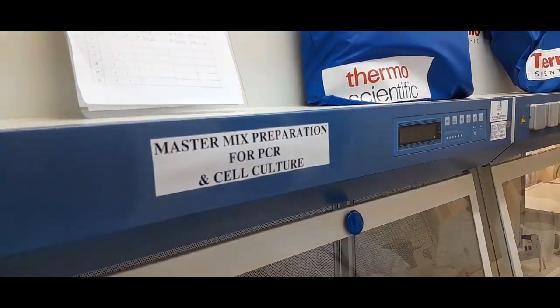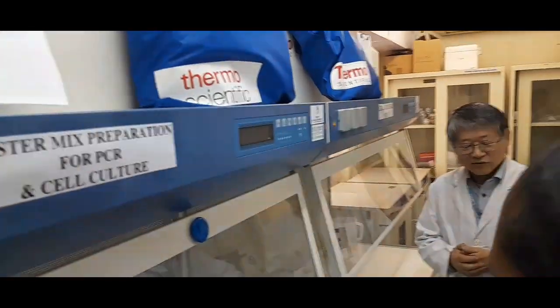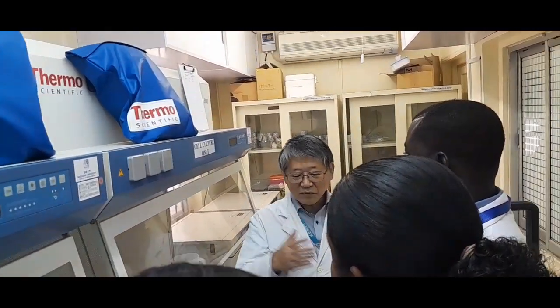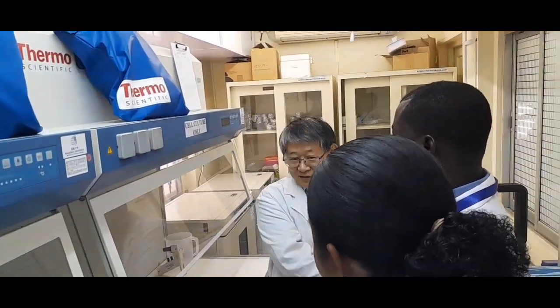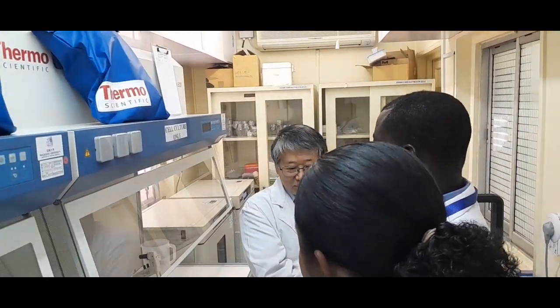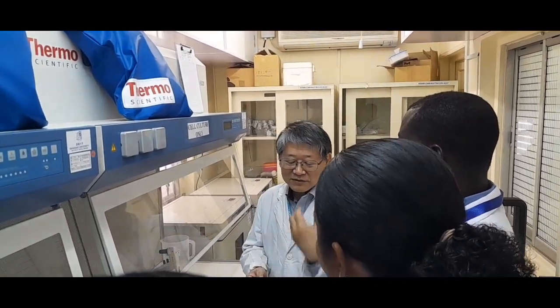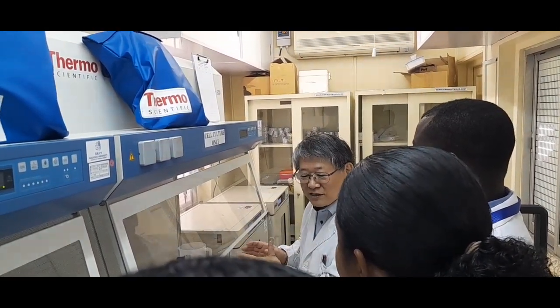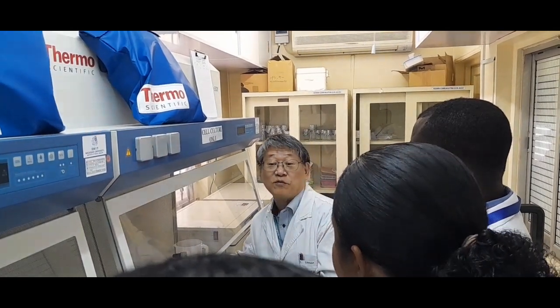You already learned yesterday from Betty that for PCR work, you should have 3 different rooms. First is a master mix clean room. Then the second is a mixture of the master mix and your sample DNA or RNA, and then you run the PCR. And the third is after the PCR, where you run the gel electrophoresis.